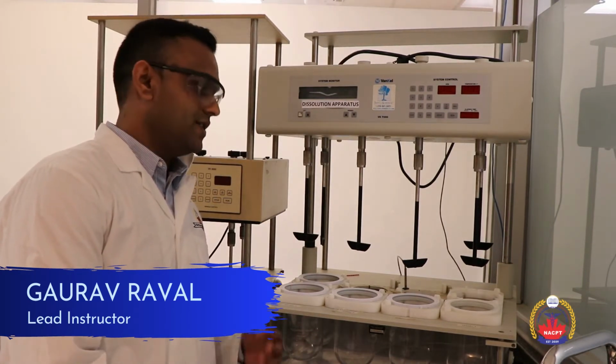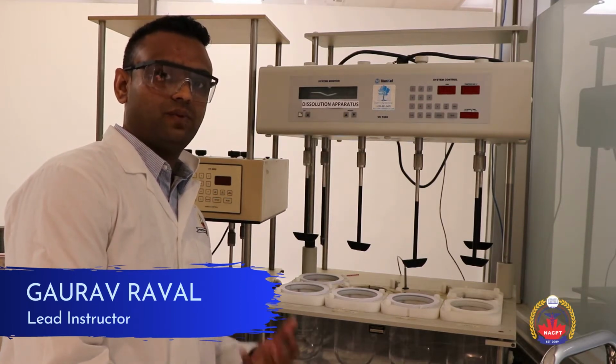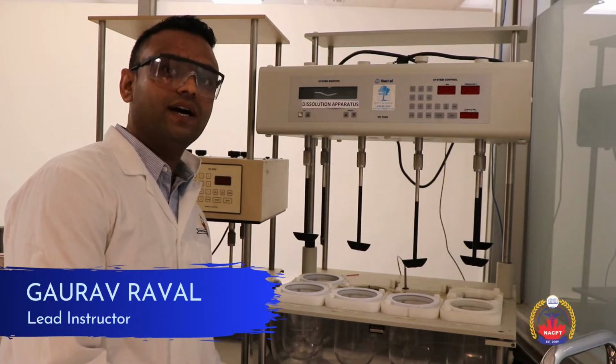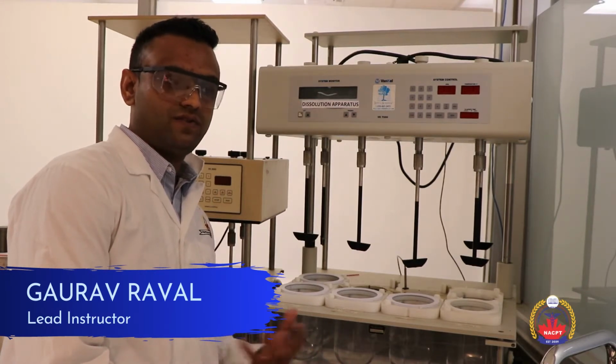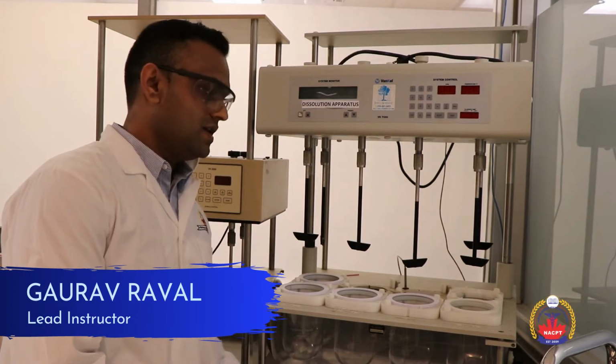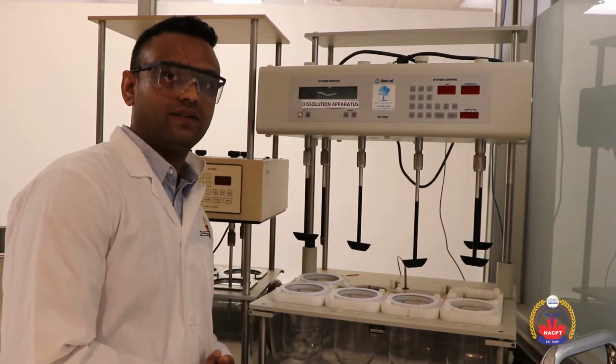Drug dissolution is a very critical aspect because it provides an in vitro drug release profile that mimics when the drug is dissolved in physiological pH in your body. So it's a very critical instrument in the pharmaceutical industry.